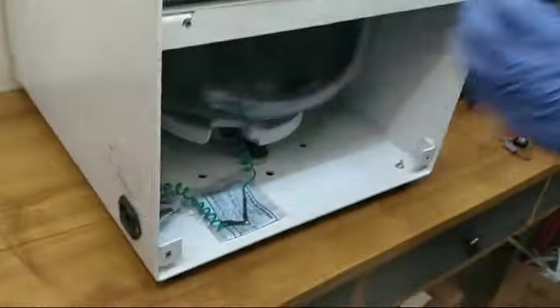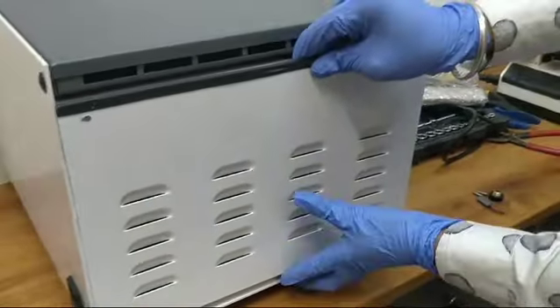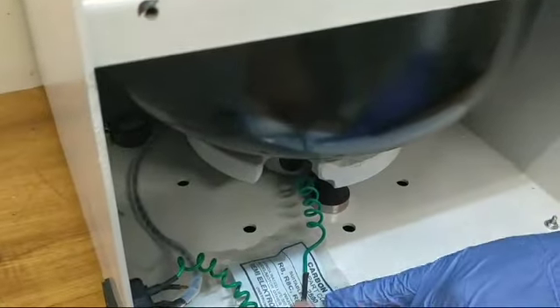Okay, so this is the back side. This also has 4 screws. I have seen it removed. This is a set here. One extra set is left here.